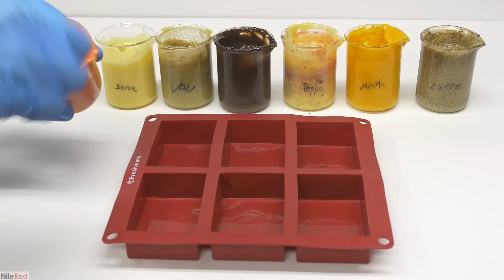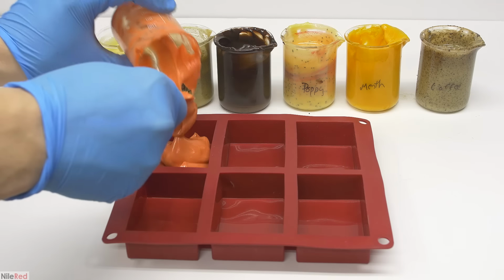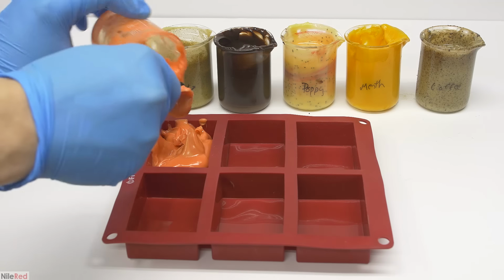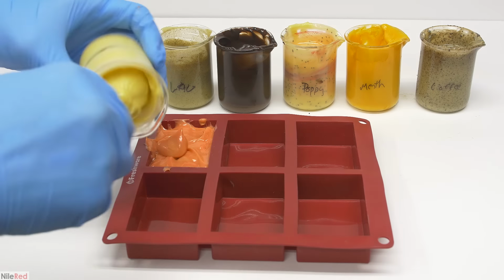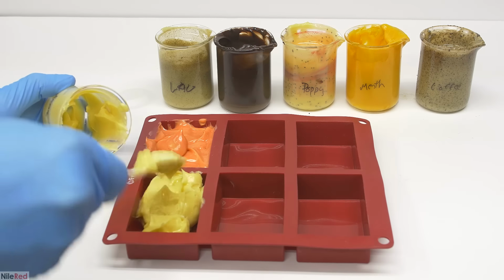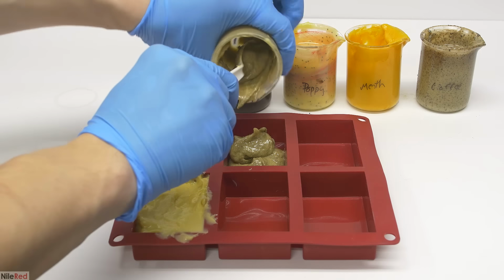By the time I started transferring things to the molds, it had already become a lot thicker. However, one thing to notice is that each batch isn't the same, and this is because different additives can affect the thickness. So for example, the first one was cinnamaldehyde, and although it was thick, it still looked a little bit liquidy. Now with the benzaldehyde, you can see it's much thicker than the last one, and it's almost like a paste. Most of the other ones were relatively liquidy, except for the menthol, which was also a paste.